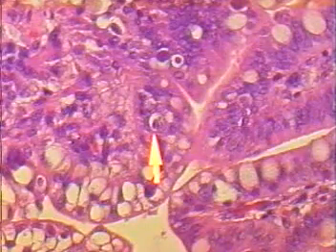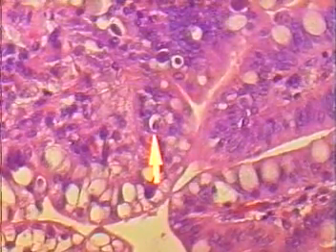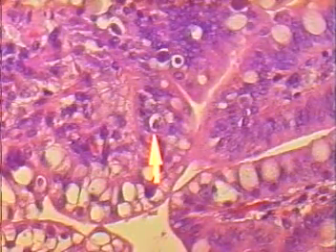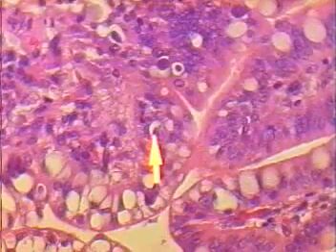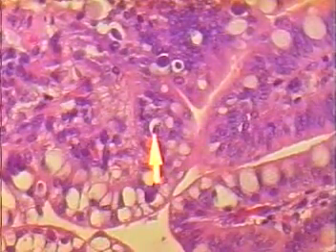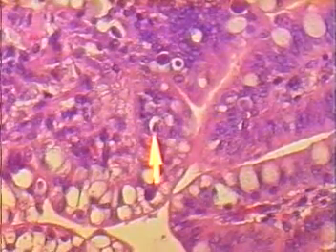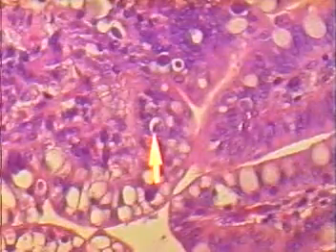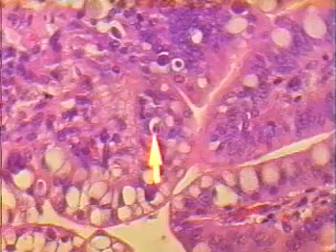We're going to go to higher magnification in this junction area and look at some of the developmental stages present there. This particular slide does show schizonts, and you can recognize them most easily once they're fully developed because of the appearance of the merozoites, which are still present in many of them. They will take on a football or spindle shape with a nucleus in the center, and if you focus back and forth on your slides you'll be able to pick those up.